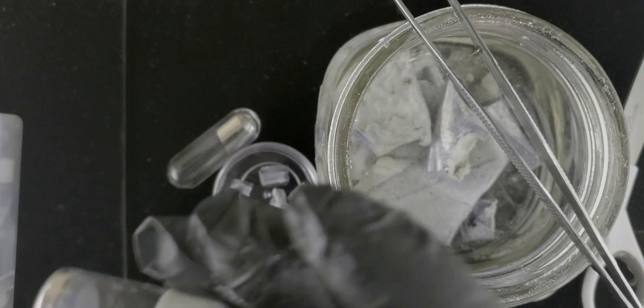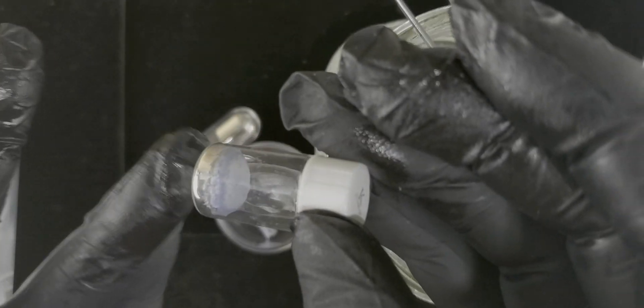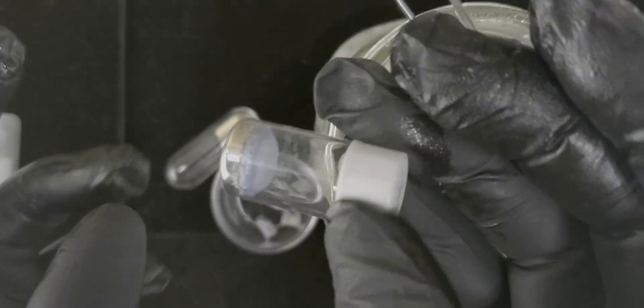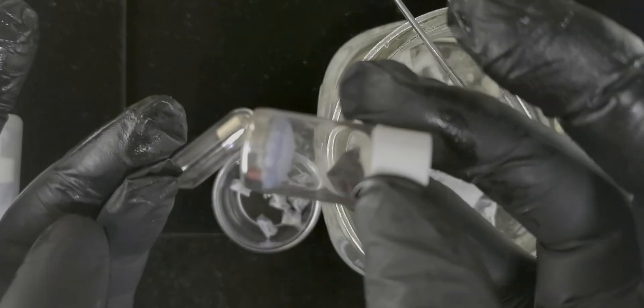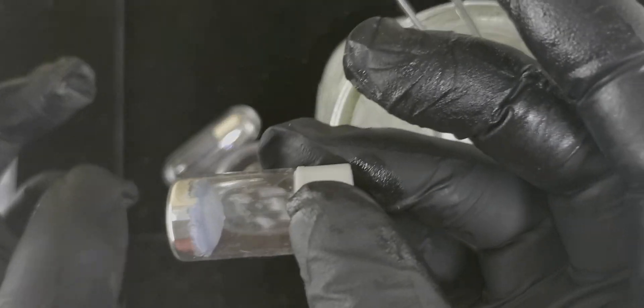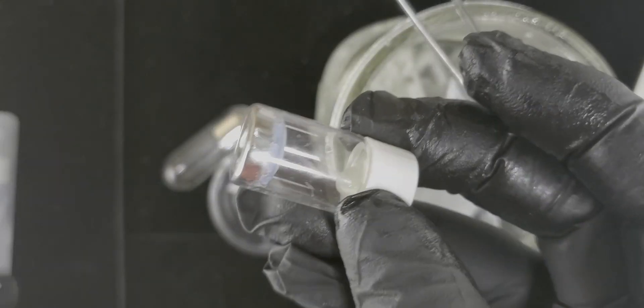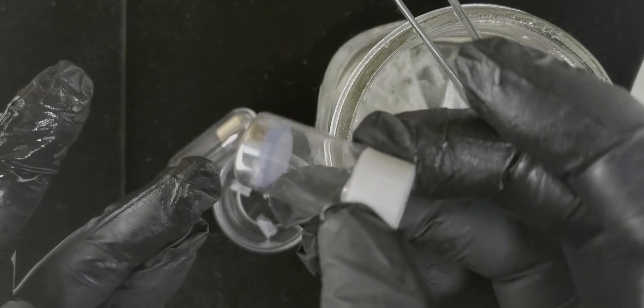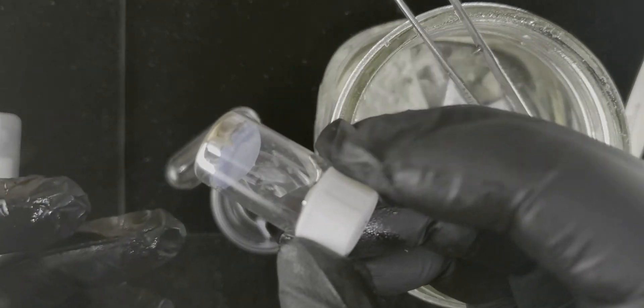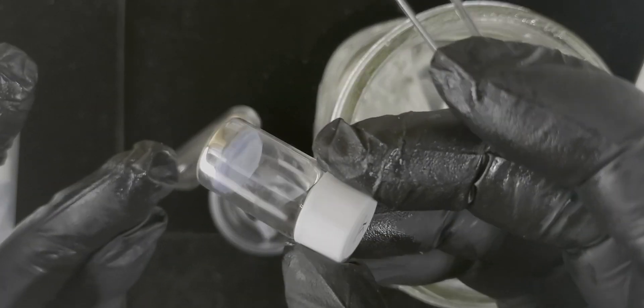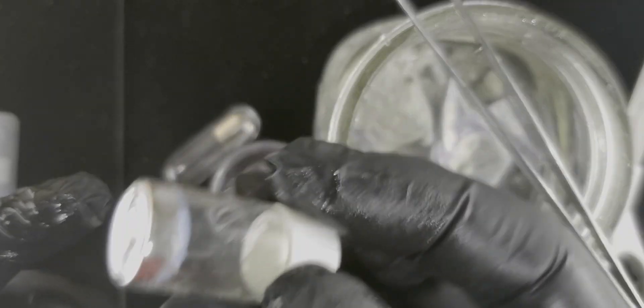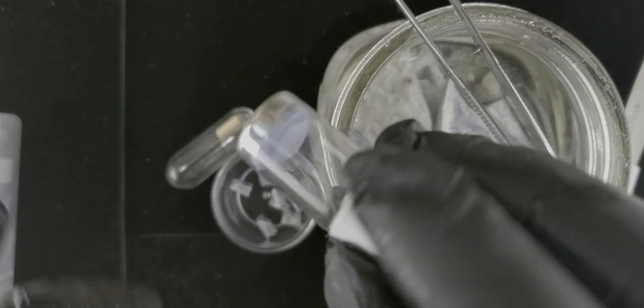But this is another attempt that we made with a dry, no oil. And just put straight argon right into these little bottles. But as you can see, there's enough oxygen that can get through the seal to mess up the surface. And it was kind of a failed experiment.